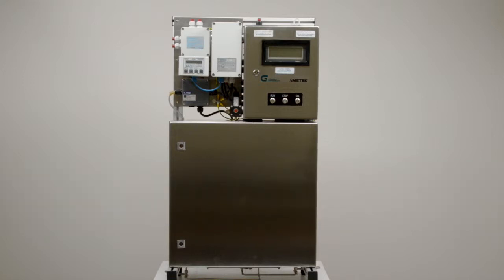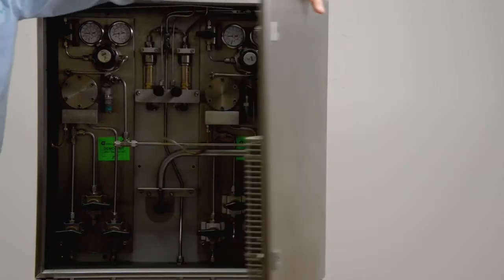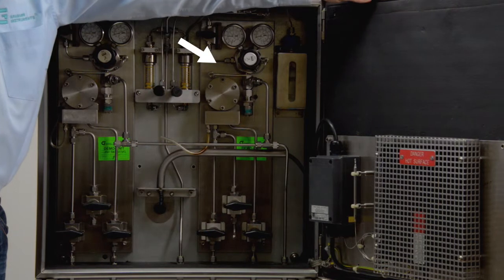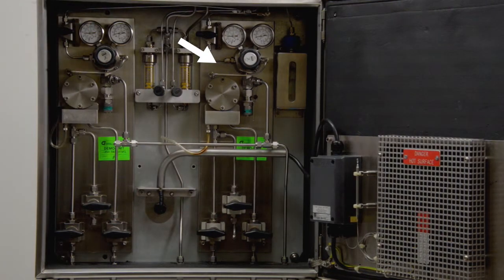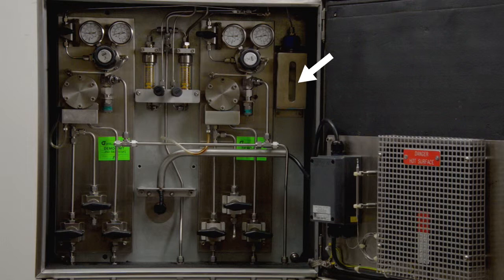A fully equipped ATEX certified MINIVAP Online consists of a purge controller and a safety relay switch in case analog data is transferred, the nitrogen purged measuring cabinet with external controls, a sample conditioning system at the bottom of the analyzer, and the container for the calibration substance.